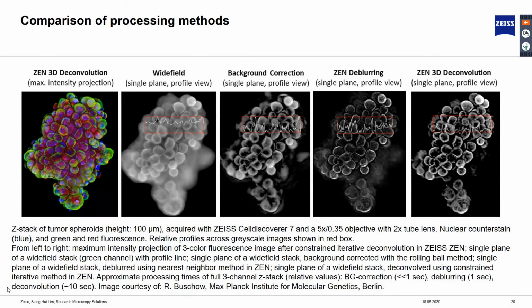What we see here is the Z-stack dataset of a tumor spheroid stained with blue, green, and red fluorescence. This dataset was acquired with the ZEISS Cell Discoverer 7 widefield system. The image at the leftmost is the maximum intensity projection of 3-color fluorescence after constrained iterative deconvolution. For the sake of comparison, only a single plane green channel dataset was used. From left to right, what we have here is the widefield image, background subtracted image, and image deconvolved with nearest neighbor and constrained iterative respectively.